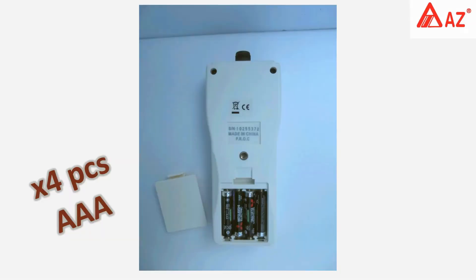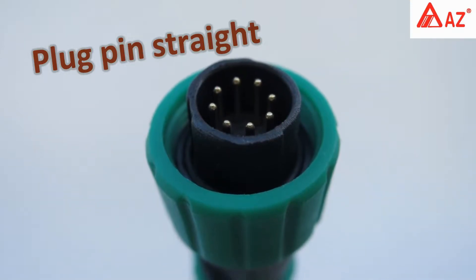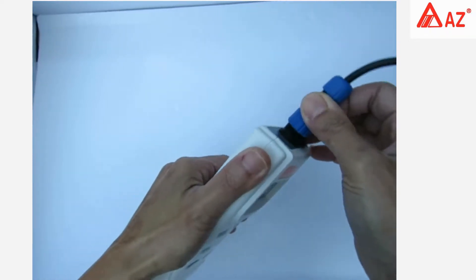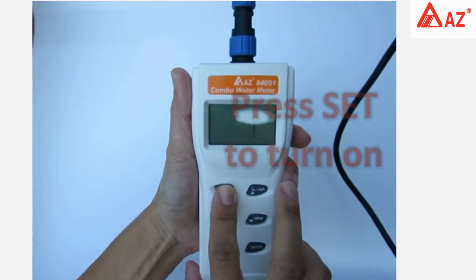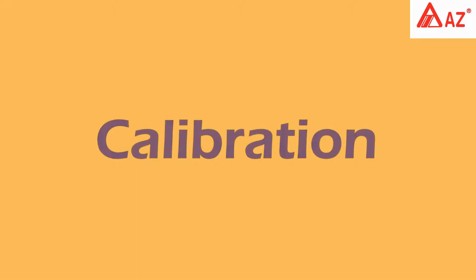Insert the batteries. The plug pin should be straight — find the installation guide between plugs and sockets, match the direction, plug in, and screw in to lock it down with the lock screw. Press Set to turn on the meter; the reading will display on the LCD.